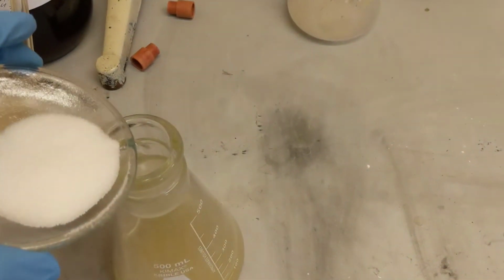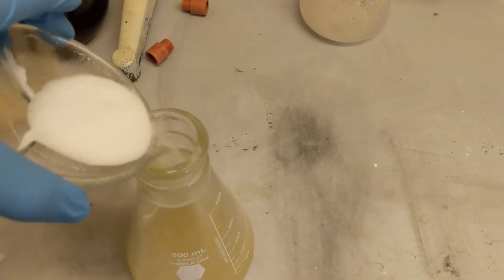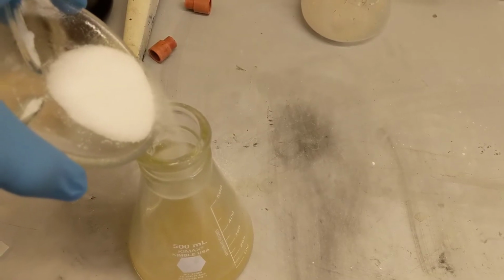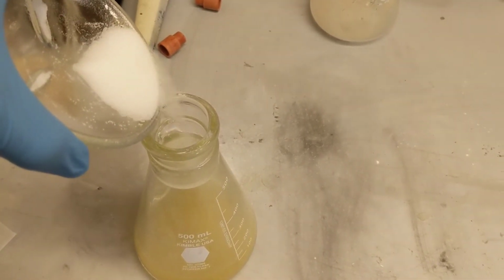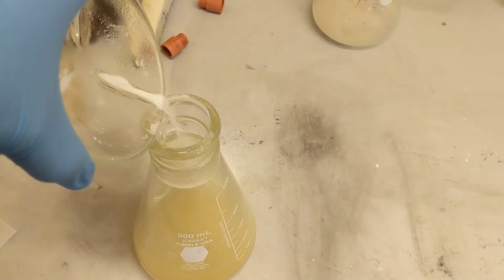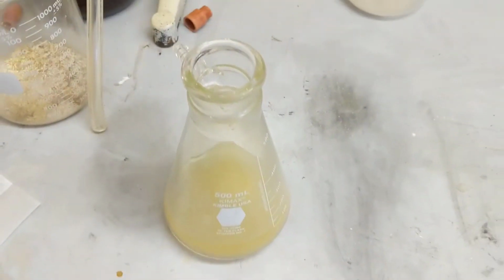Should I do this without a funnel, guys? Should I? Oh. Oh yeah. Not really though. It's alright, I'll fix it.